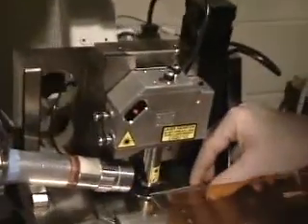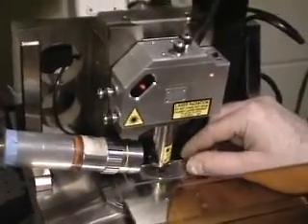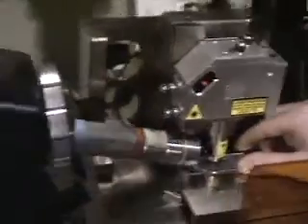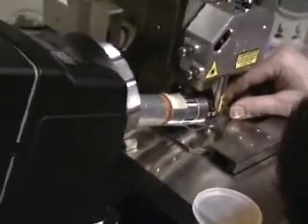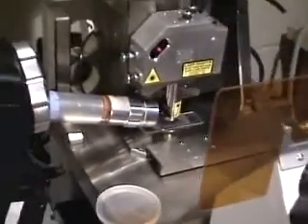And in fact, let me go ahead. Let's say I was going to image this sample, I'll carefully slide it in. So first I put it flat off to the side, then slide it in. There's always a little bit of the laser beam that spills off the side of the cantilever, and so that tells me where the cantilever is going to come down on the sample. So I can roughly position this to any part of the sample that I want, even when it's pretty far away.